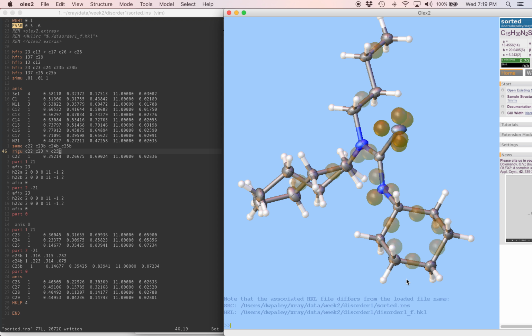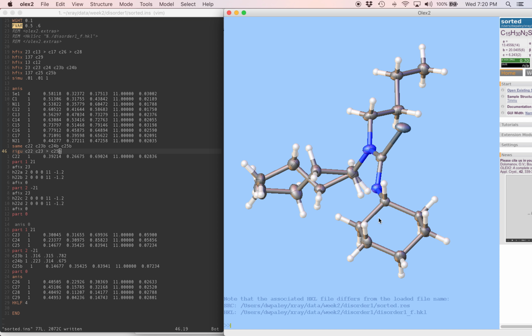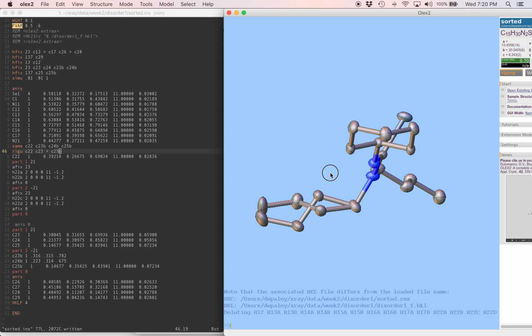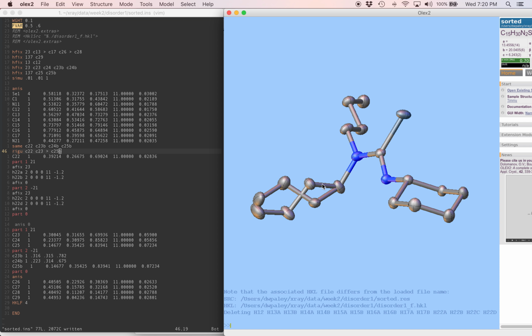The final thing that we want to check is the geometry of this model that we built, and we want to look in detail. We want to have kind of extra scrutiny on this disordered thing. So I'm going to get rid of the hydrogens for now, just because we don't need them. I'm going to check these bond lengths one more time. We changed the model, we went anisotropic, so everything we checked before, we're going to check it again. We have a 1.58 angstrom bond and a 1.52 angstrom. Those are a bit different from each other, maybe a bit funny.